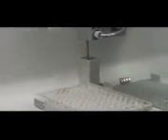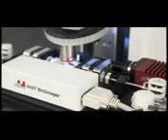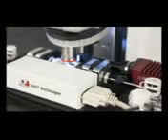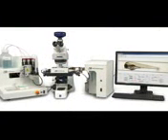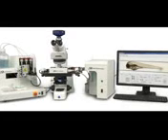Another option is the use of Union Biometrica's LP sampler to gently aspirate larvae from the well of a multi-well plate, allowing the VAST to process the contents of the well, unload the larvae, and flush the sample line before continuing the process for the next well and each location of the multi-well plate. In this manner, the VAST reliably performs the tedious steps of loading, rotationally orienting, and linearly positioning zebrafish larvae for the automatic collection of high-resolution and high-content images in a walkaway platform.